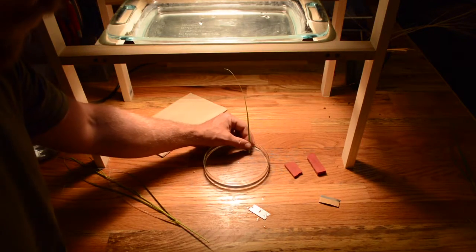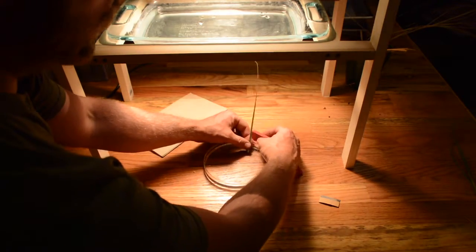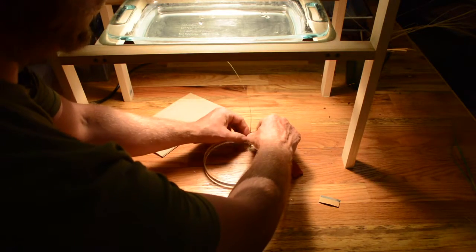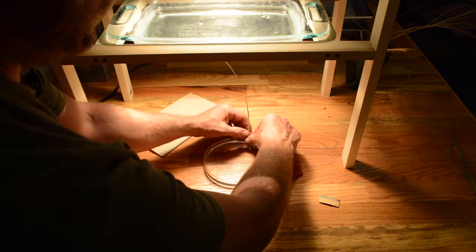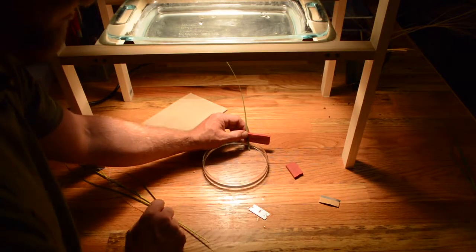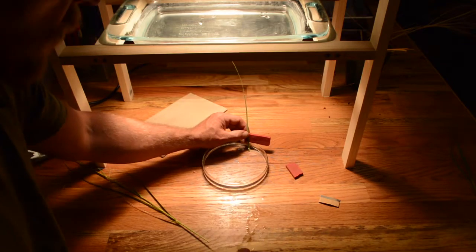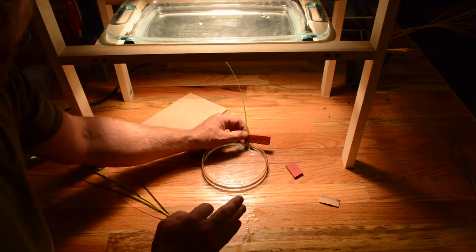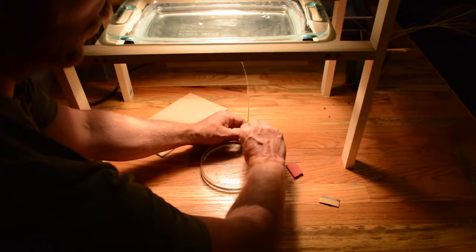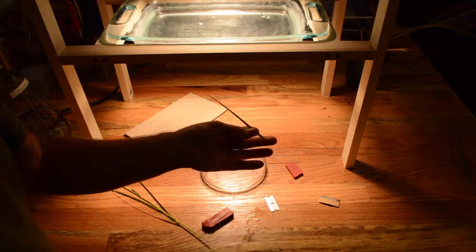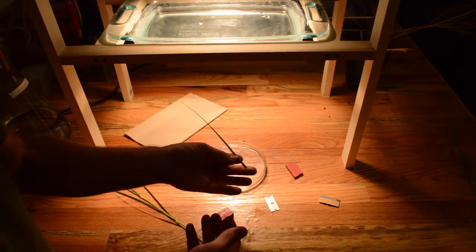While holding that base underwater, I'm going to go ahead and put one of these rubber pads behind it. Because when it's done rehydrating, I'm going to make another cut above the water surface. And that's how we're going to measure leaf water potential on this rehydrated leaf. So make sure you've got a nice dry razor blade. I'm going to pretend we're at 30 seconds exactly. So I'm going to re-cut this leaf. Now I'm going to go over to our pressure chamber and measure leaf water potential on this rehydrated leaf.